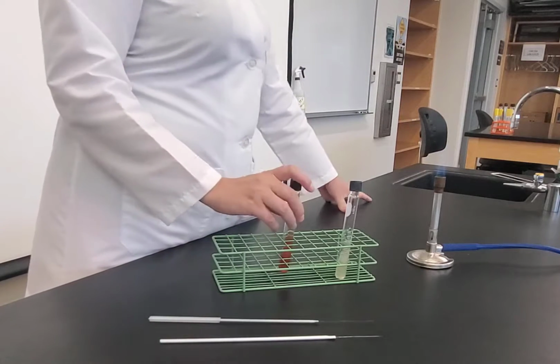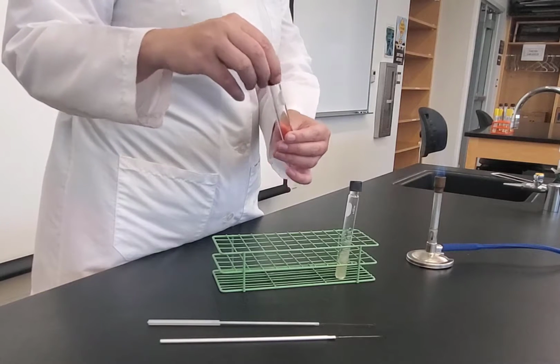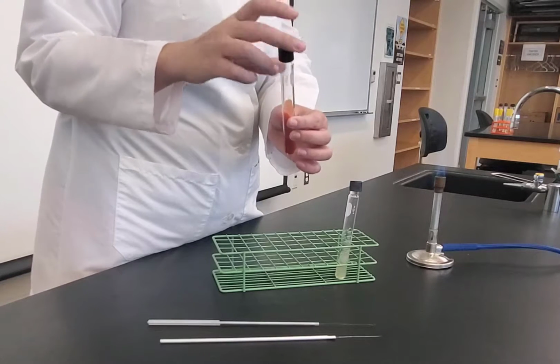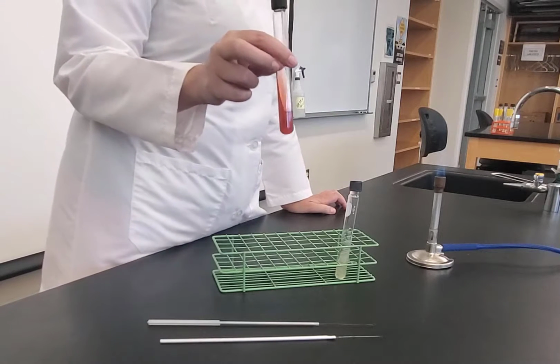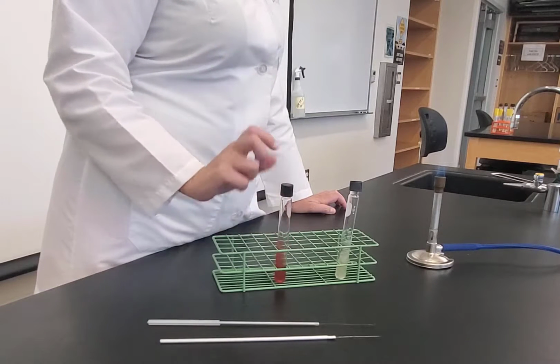Set that down. I would make all 7 of my organisms. Again, these are screw tops, so you're going to put the cap on tight and then a half turn loose so that the cap is still loose and air can get in. And so I would take all 7 of my tubes that I inoculate and stick them in the incubator, and after 48 hours I would record what my tubes look like.